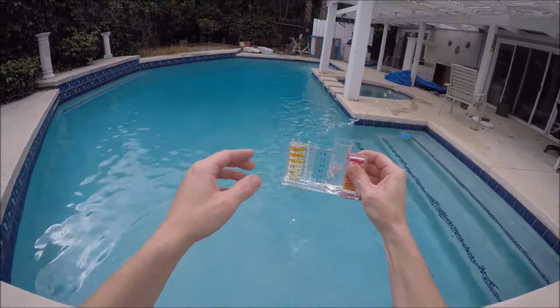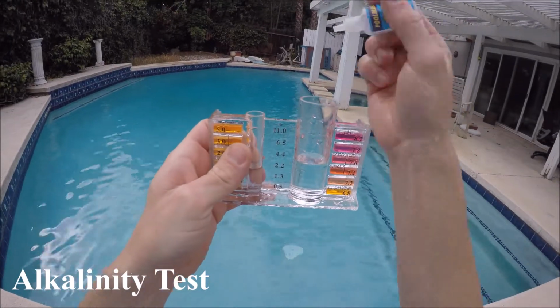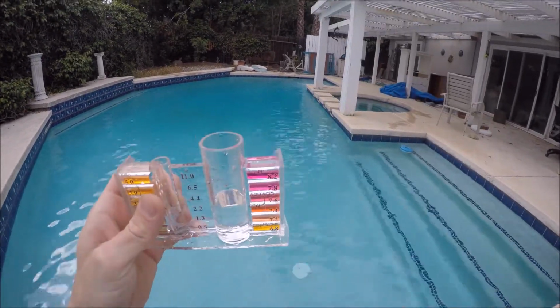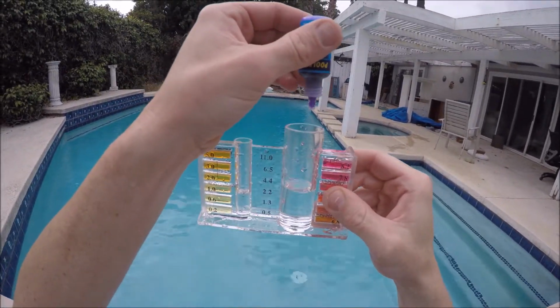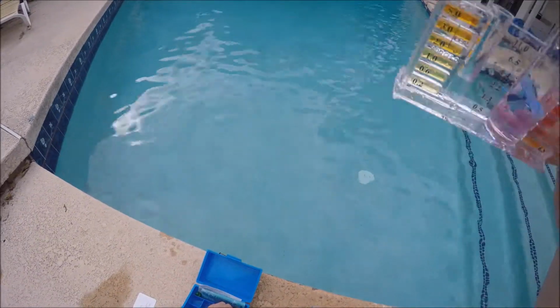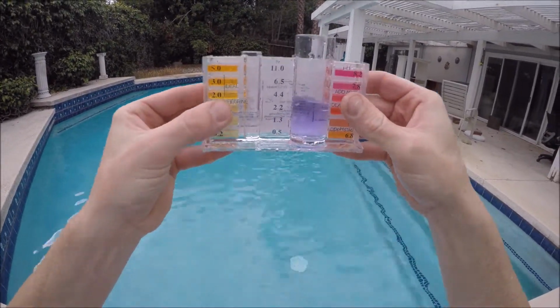We'll now be testing for alkalinity by lining the water up with the line on the pH side that indicates alkalinity. Just like with pH, we start with 2 drops of the number 4 reagent, which will neutralize out the chlorine. We then add 1 drop of the number 5 alkalinity test reagent and swirl. Again, we place the white card behind the testing block so that we get the most accurate results.